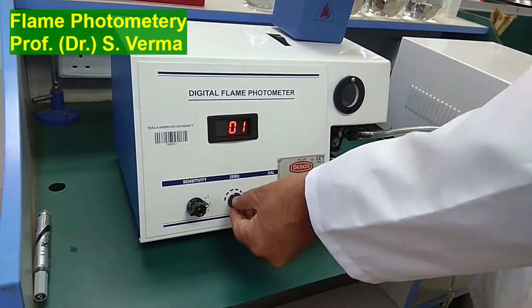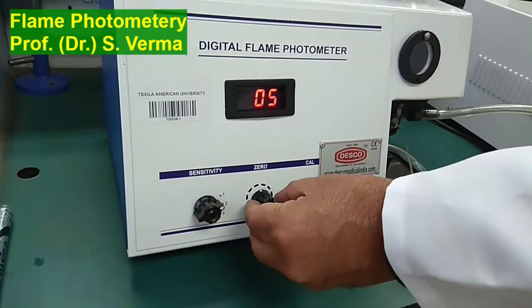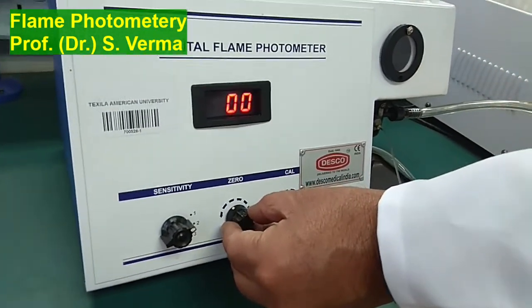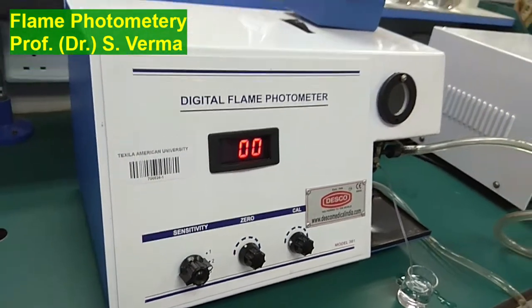If it is not 0, you can always adjust using this knob. I've disturbed it so that I can show you. I'm bringing it back to 0. So this is now adjusted at 0.